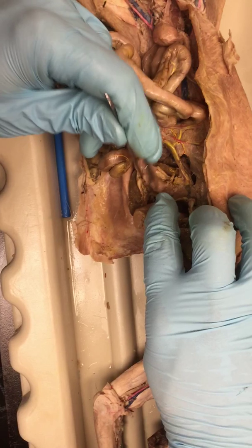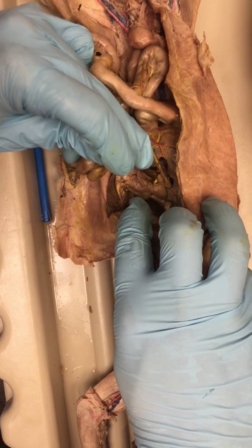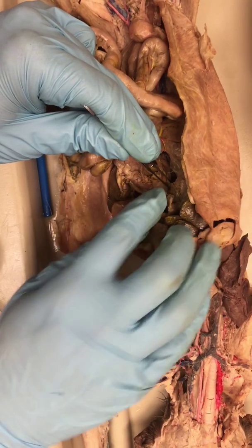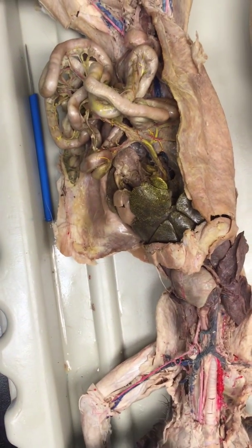And at this point, you're going to find this little branch right here, which is not on your test really, but I show it to everyone because it's super easy. The gastrosplenic vein, and then all the way at the top where it connects with the liver is the hepatic portal vein. And that is everything you need to know about the cat except for the male dissection.